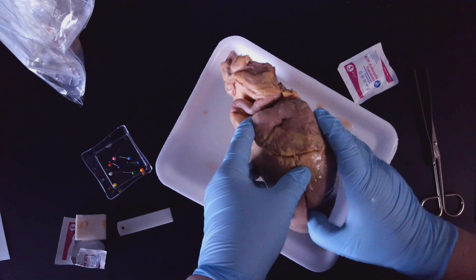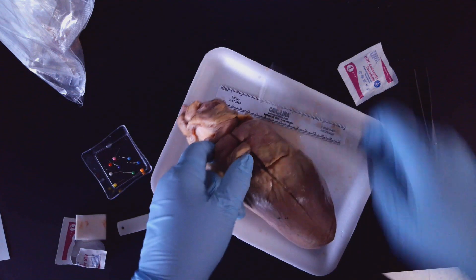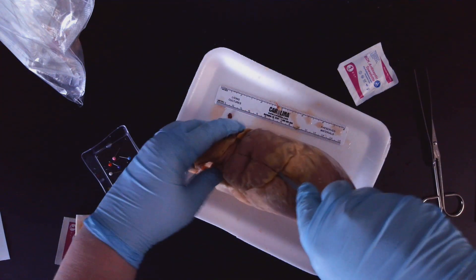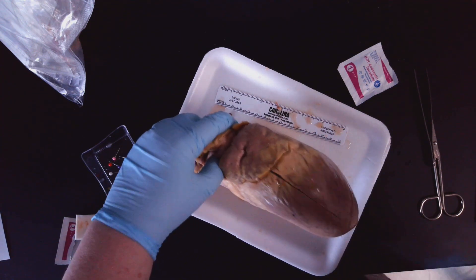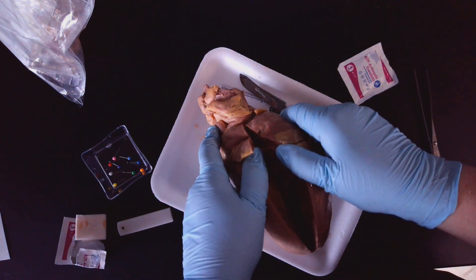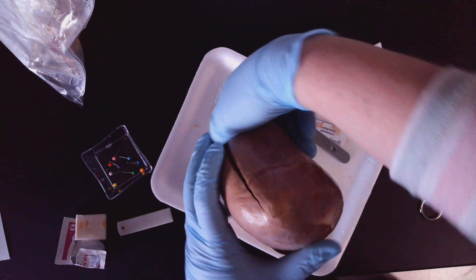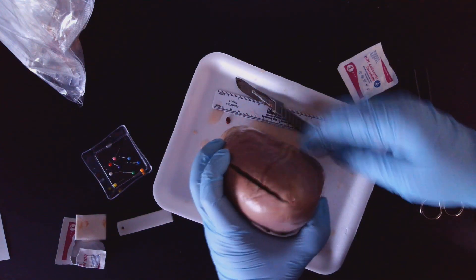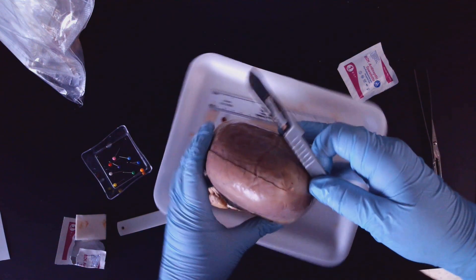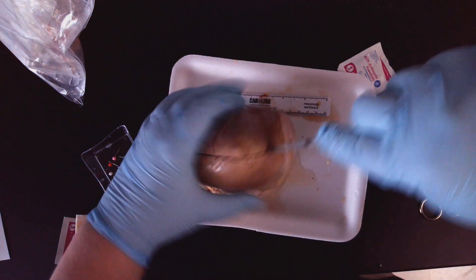I'm going to put my fingers in here and see if I'm starting to pull it away. All right, it's still held a little tighter. So I'm going to go back — moving my fingers out of the way — and go back to that area, go down a little bit, then set the scalpel down. That looks better. Now I'm going to tilt the heart, kind of stand it on its vessels at the top.